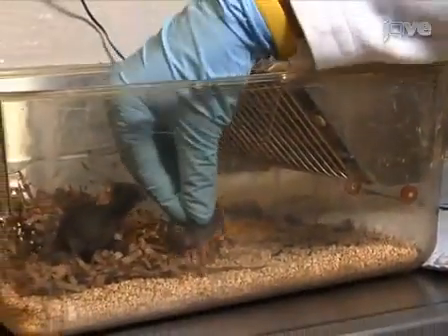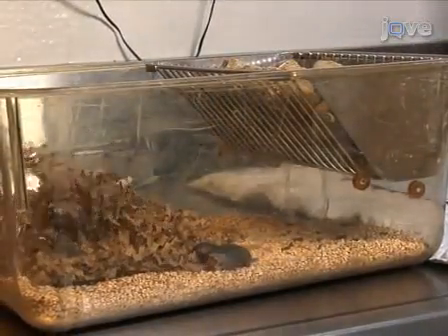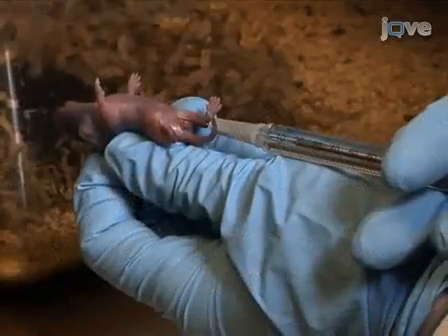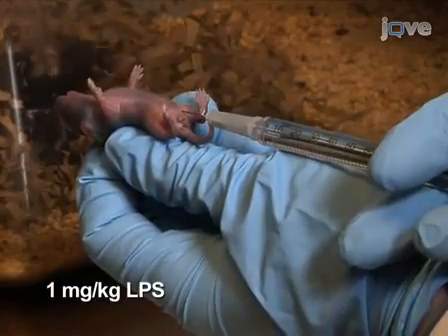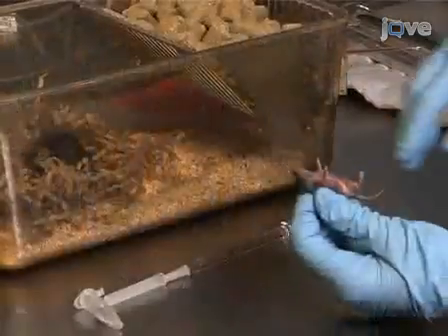For creation of brain injury with combined hypoxia, ischemia, and infection inflammation, the animal is injected intraperitoneally with 0.015 milliliters of lipopolysaccharide, and then returned to the dam.